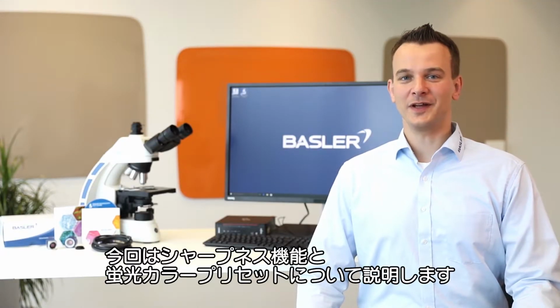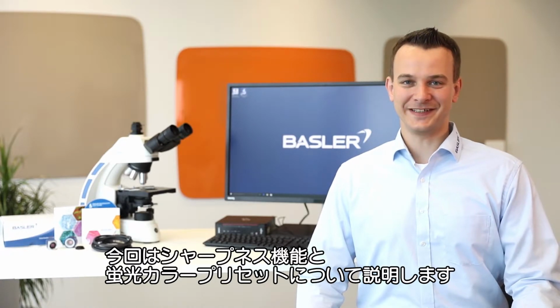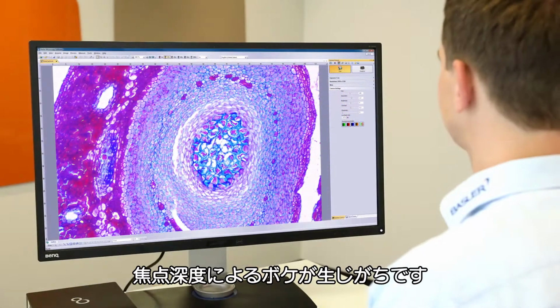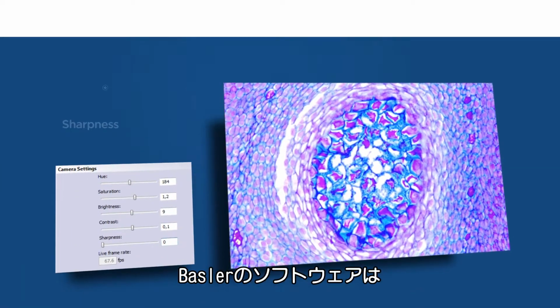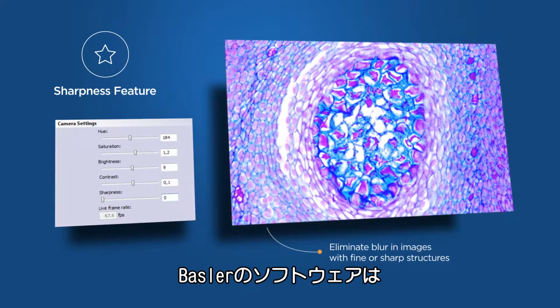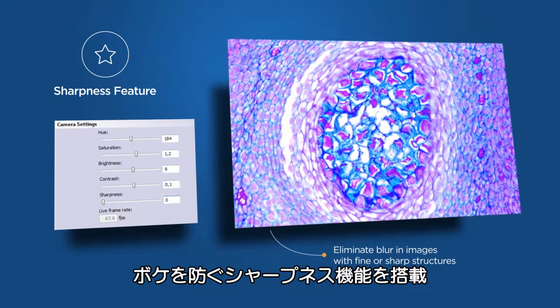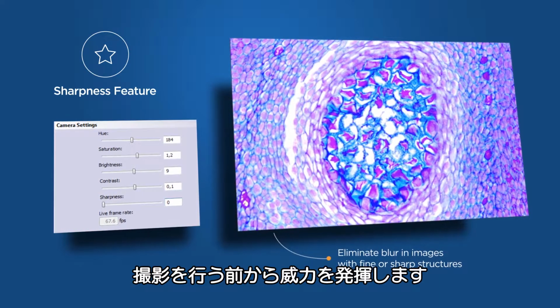Today we have a closer look at the special sharpness feature and time-saving fluorescence color presets. When using high magnifications with any kind of microscope or camera, blur occurs due to a limited depth of field. To improve the image quality, Basler has implemented a sharpness feature that eliminates blur in image areas with fine or sharp structures, even before taking a picture.